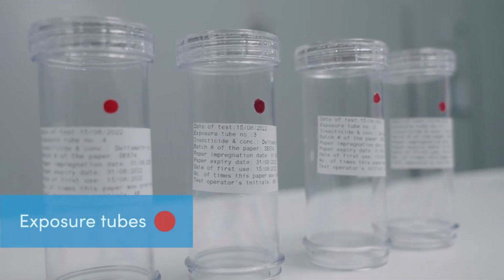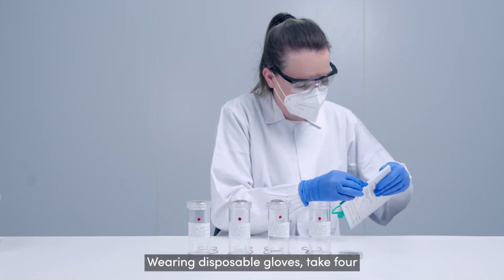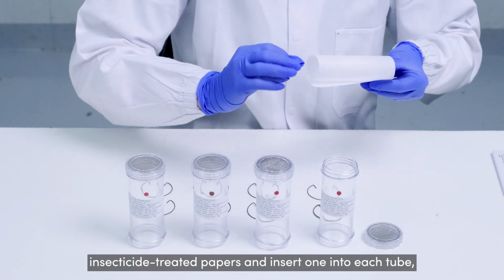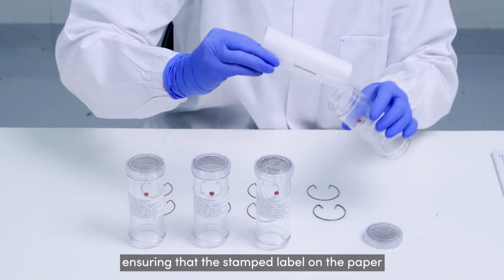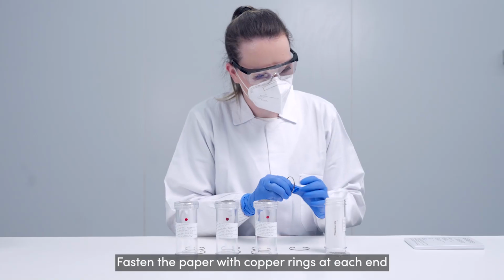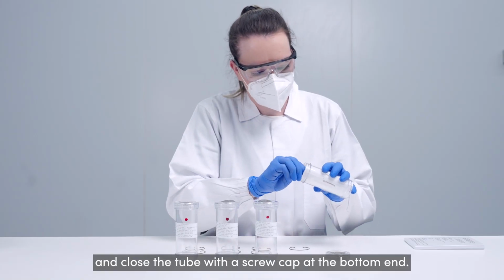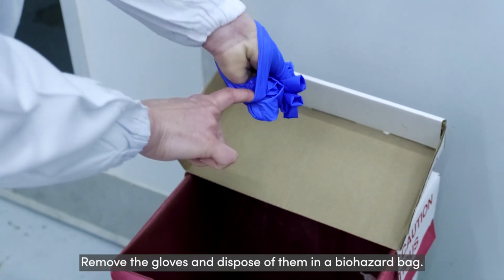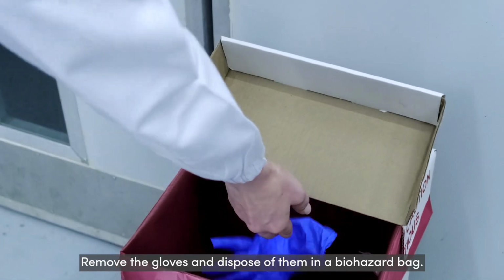Prepare the red dotted exposure tubes. Wearing disposable gloves, take 4 insecticide-treated papers and insert 1 into each tube, ensuring that the stamped label on the paper is on the outer side and is readable. Fasten the paper with copper rings at each end and close the tube with a screw cap at the bottom end. Remove the gloves and dispose of them in a biohazard bag.